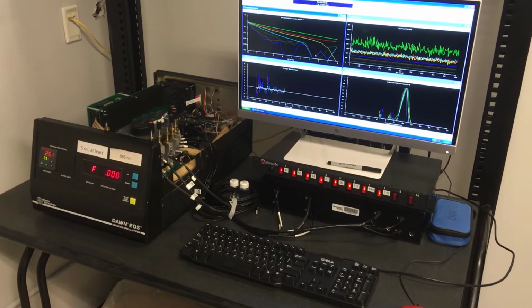After the data are gathered, we're going to drop them into an Excel spreadsheet. This too is a pretty fast process, and it's just the beginning of the analysis, but you'll see that we can get the data out and into some manageable form like Excel very simply. So what I'm going to do now is operate the instrument and walk you through a little tour of it.